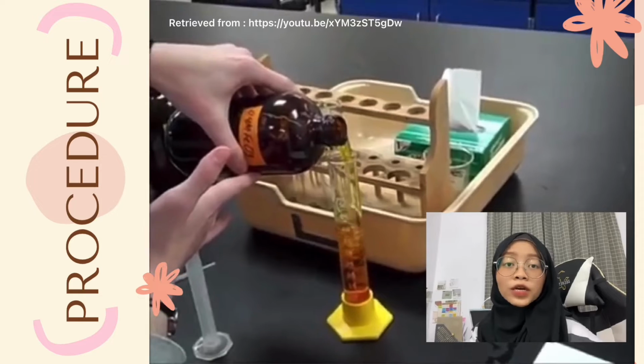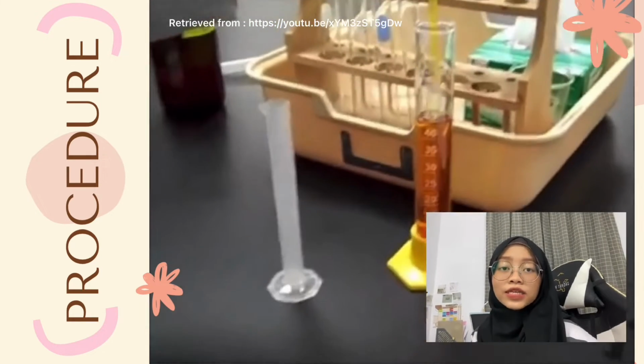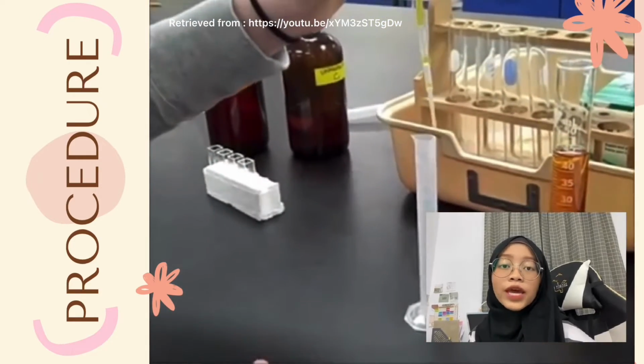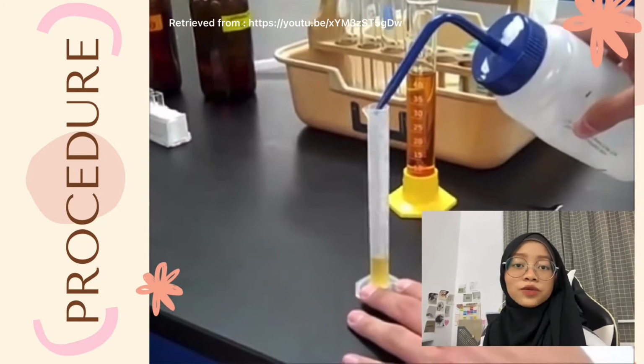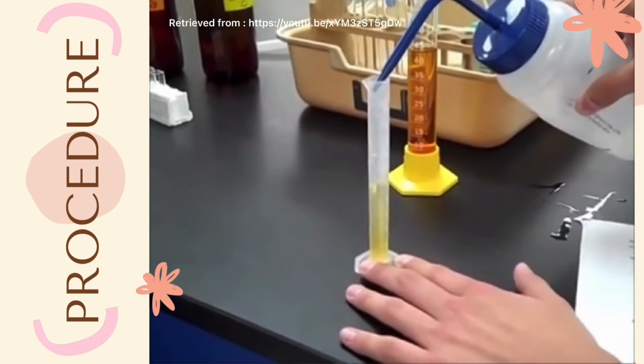To prepare a 1/10 dilution of iron trichloride, 1 ml of stock solution of 0.4 molar iron trichloride was pipetted into a 10 ml measuring cylinder. Then 9 ml of distilled water was added into the same measuring cylinder to dilute the solution.